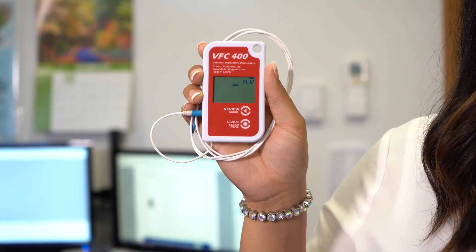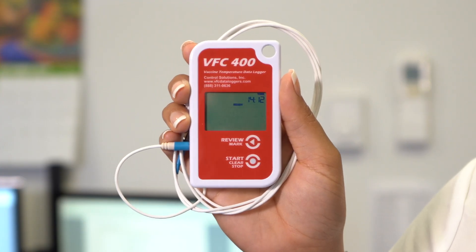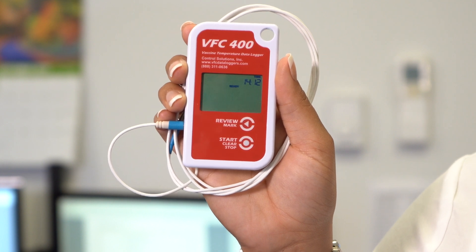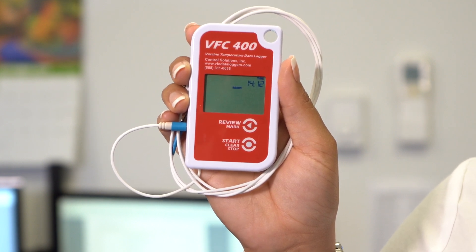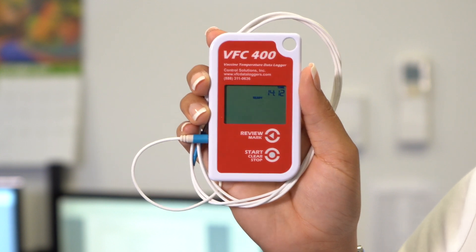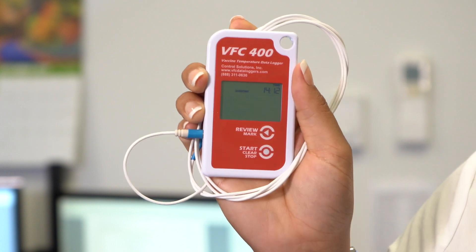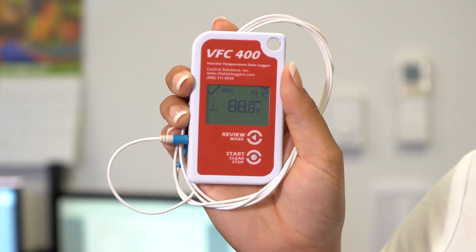Now that the VFC 400 has been configured, you will see the word ready on the screen. This means that it is ready to start as soon as you plug it into the probe and hit the start clear stop button. When you are ready to start it, simply hold down the button. When the word ready goes away, let go and the temperature will show up.